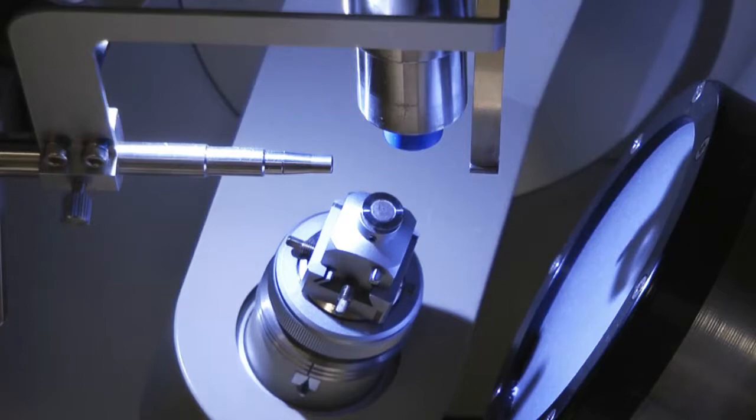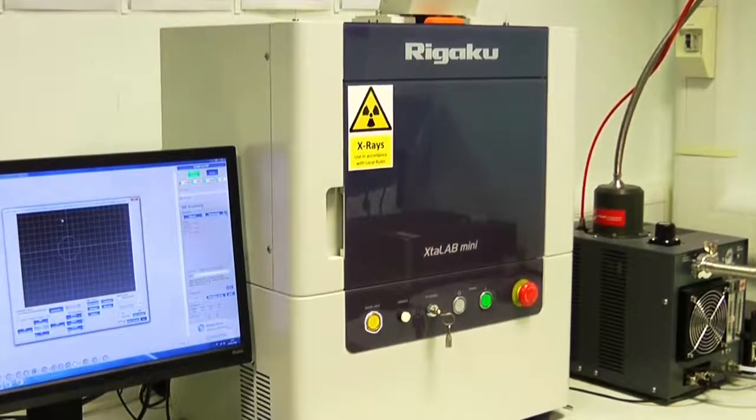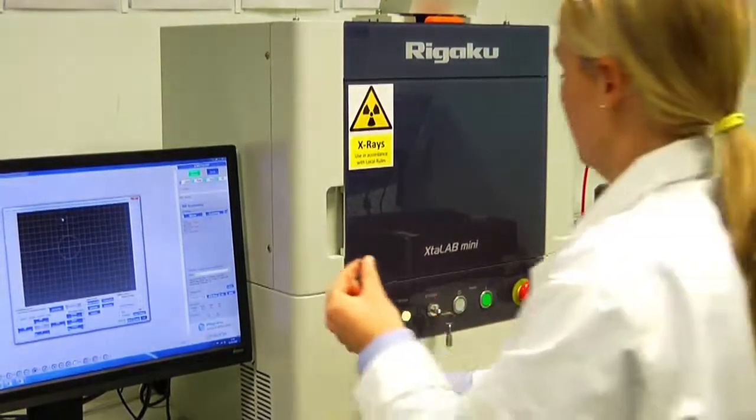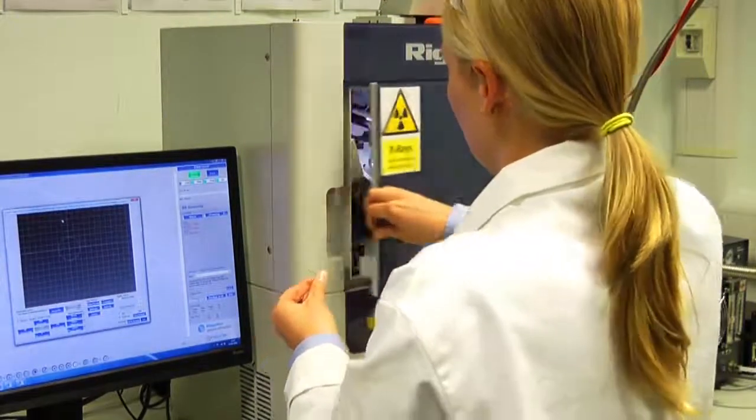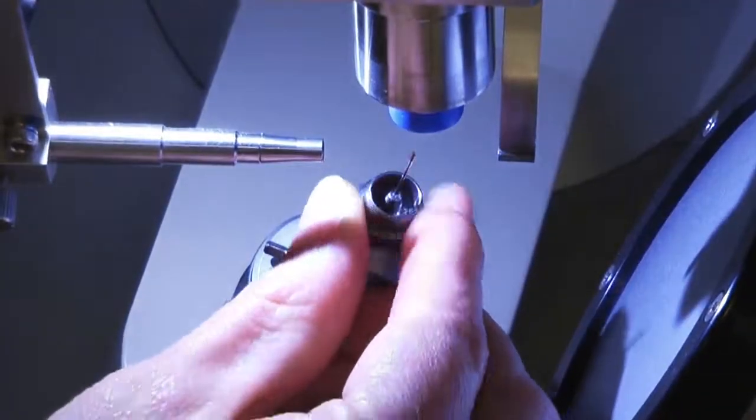There is also a camera positioned in the cabinet to help with centering the crystal. To open the door of the instrument, press door lock, which turns the X-rays off. A beeping sound occurs when the door is unlocked and open as a safety precaution. Place your sample on the magnetic base of the goniometer head.